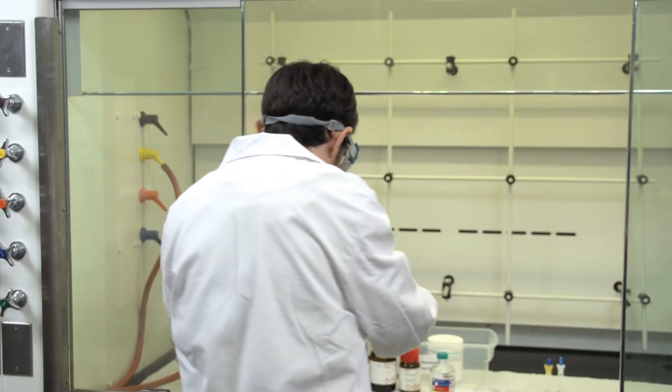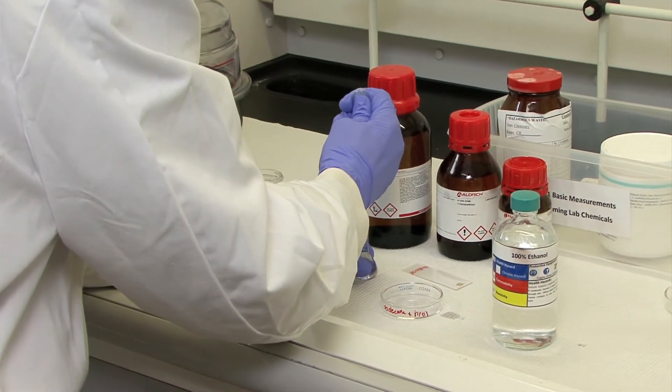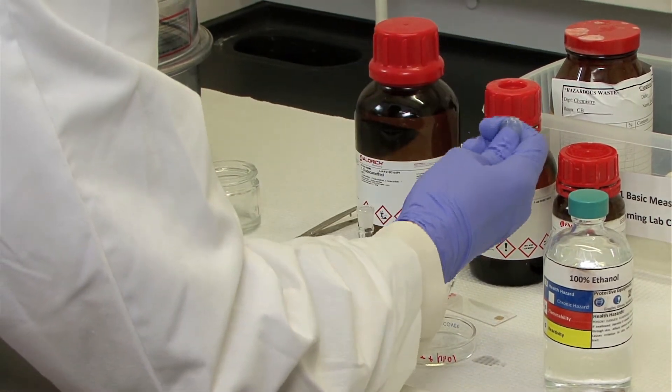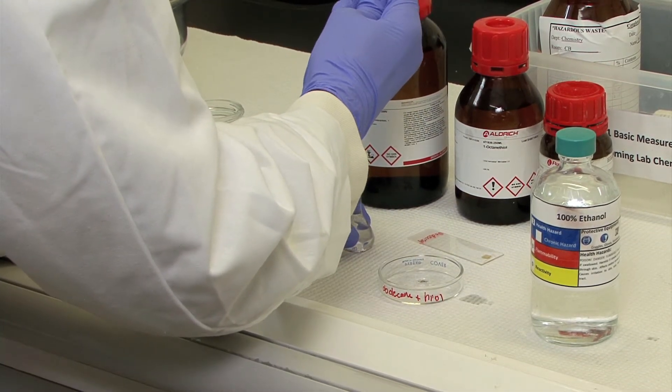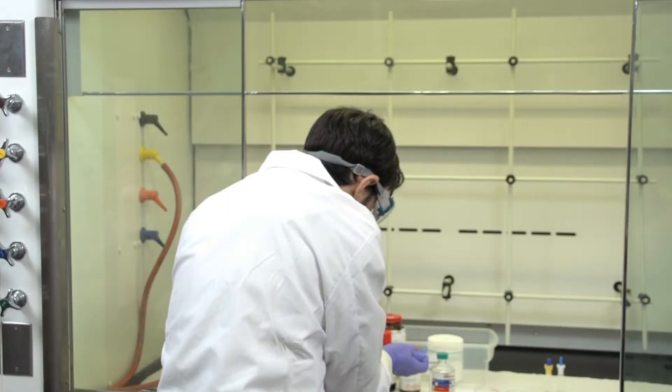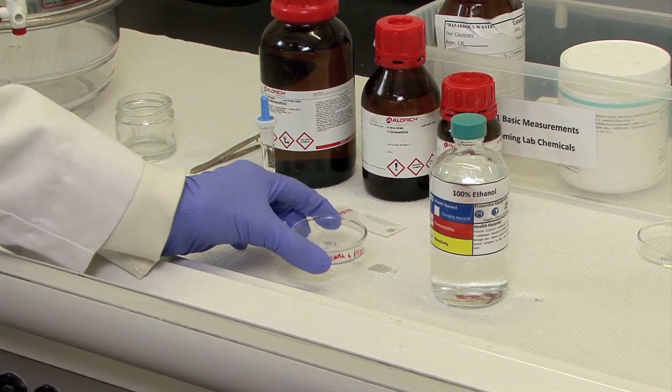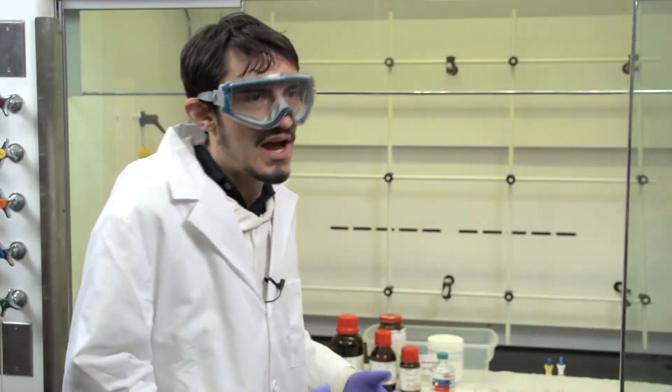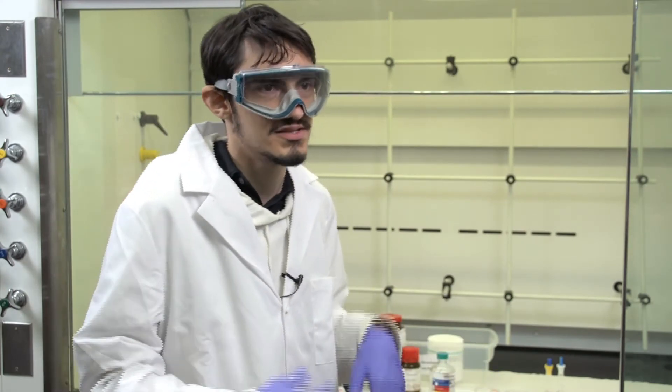Under the hood open up the solution of the Thiol using a plastic disposable pipette. Place a couple of drops of the Thiol on the surface of the stamp. Be sure to discard your pipette immediately after. Let the Thiol solution stay on the surface of the stamp for about 5 minutes or so. If you get the Thiol solution on your gloves be sure to immediately dispose of your gloves and put on new ones as the smell is rather unpleasant.